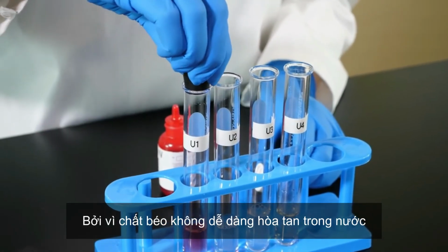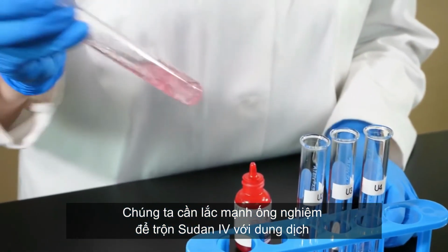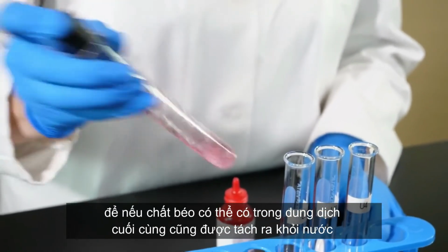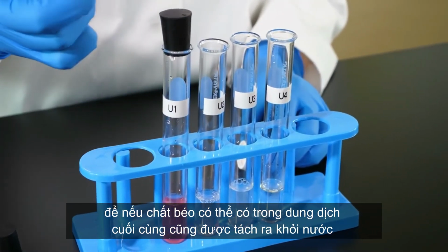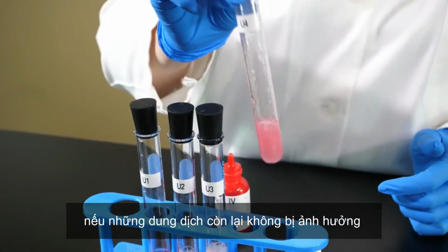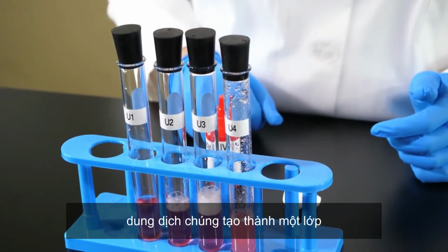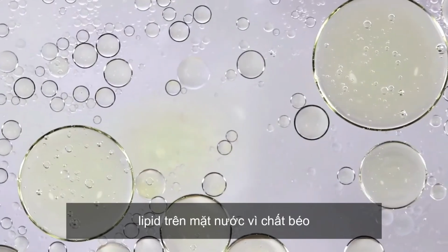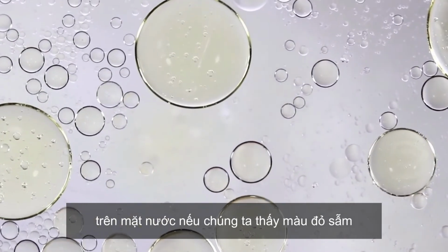Since lipids do not easily dissolve in water, we need to shake the test tubes vigorously to mix the Sudan-4 with any lipids that might be in the solution. Any lipids present in a solution will eventually separate from the water in the solution if the solution is left undisturbed. When lipids separate from water in a solution, they form a layer of lipids on top of the water. Since lipids are less dense than water, they float on top of the water.